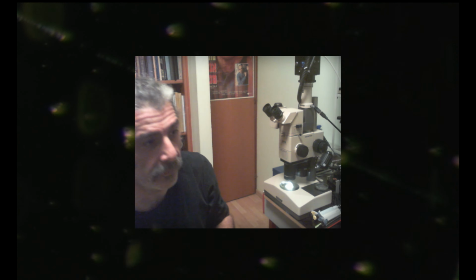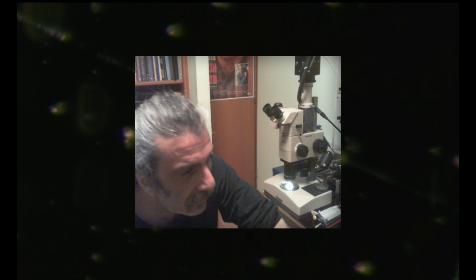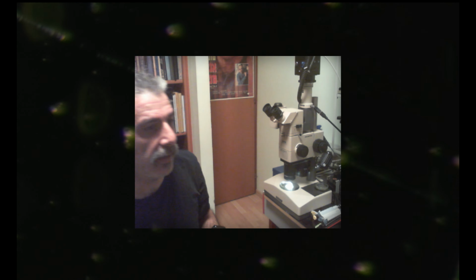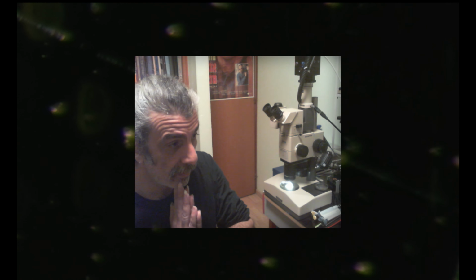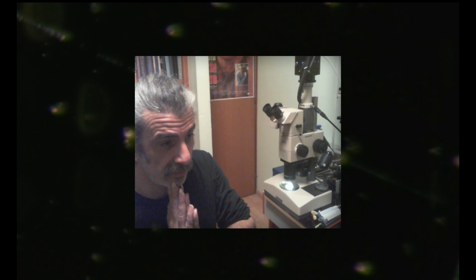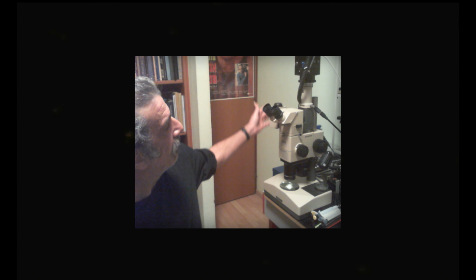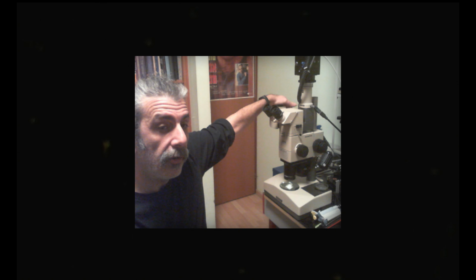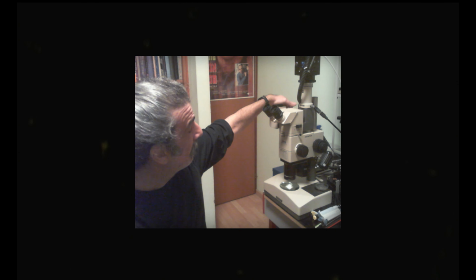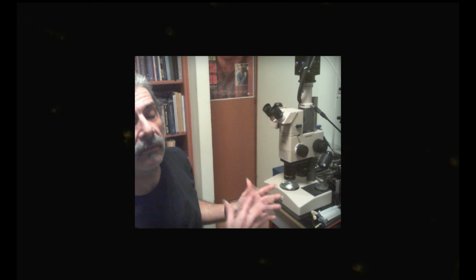So it's gonna be somewhat with technical problems because my Wi-Fi started to make some hiccups. I want to focus today on using the stereo microscope as the beginning of our sample scanning and pipetting the specimens out of it.